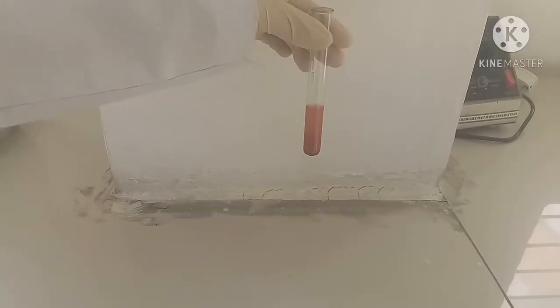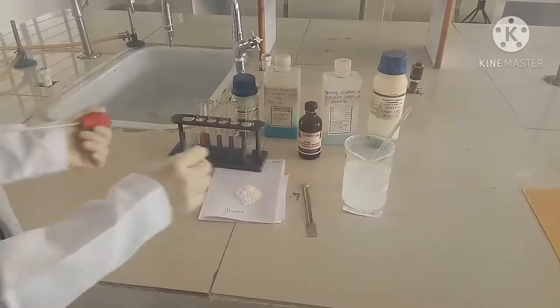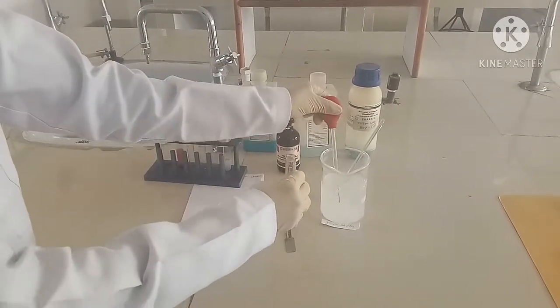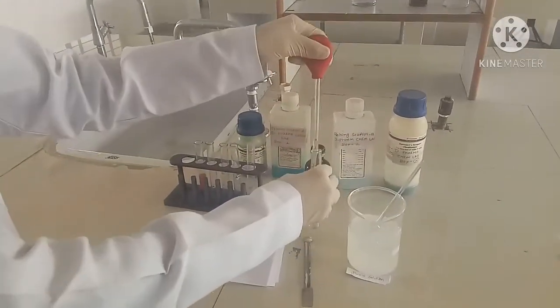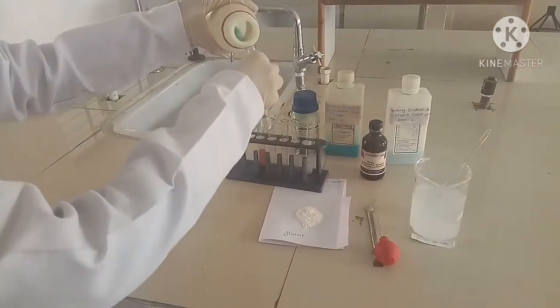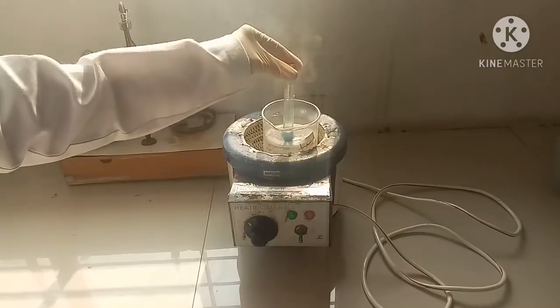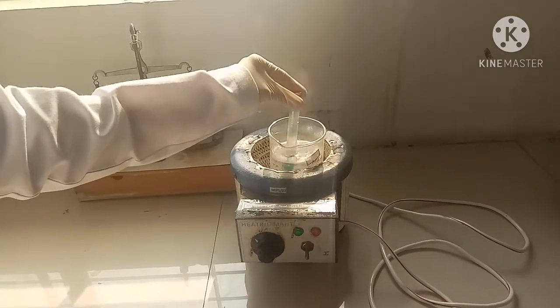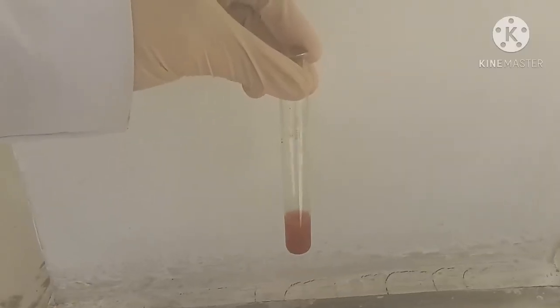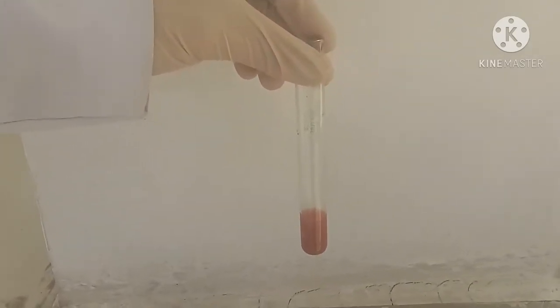Look for the development of a red precipitate. Now I perform the Benedict test for carbohydrate. Take 1 ml of sample in a test tube, then add Benedict reagent. Boil for 3 to 5 minutes in a boiling water bath and observe for colour change in the solution or precipitate formation.